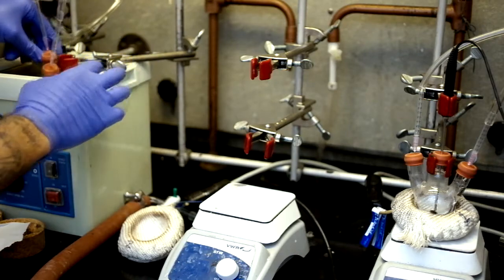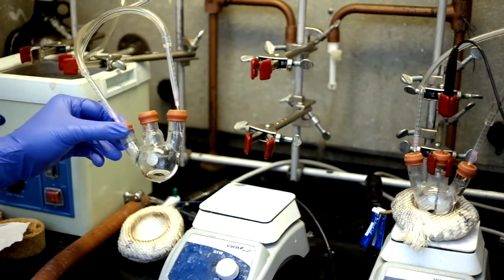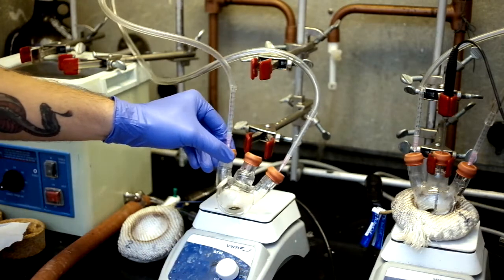After 30 minutes of sonication, you can take the tellurium flask out of the sonicator and check to make sure all of the powder is dissolved. If it is, leave it on the side for the next step in the reaction.